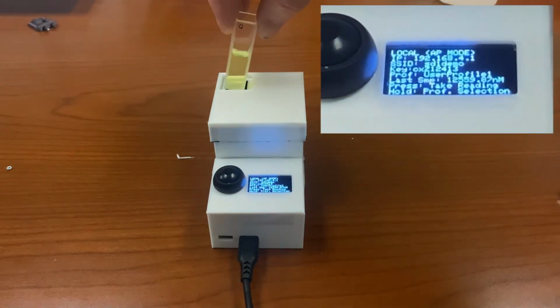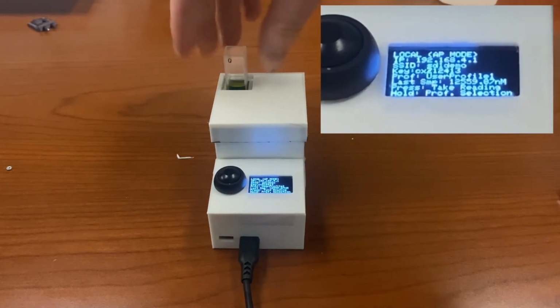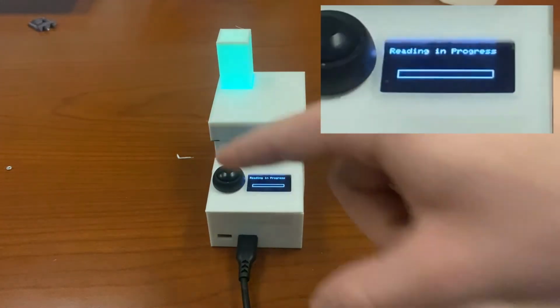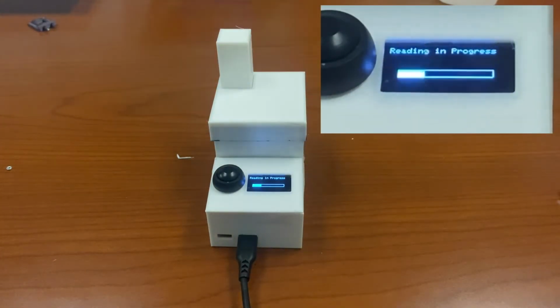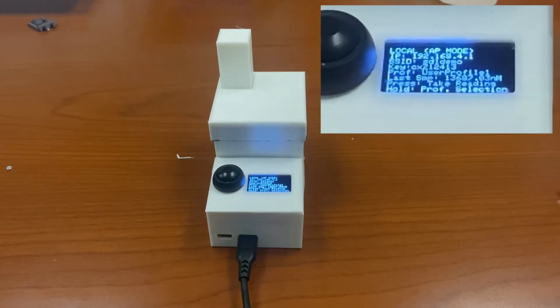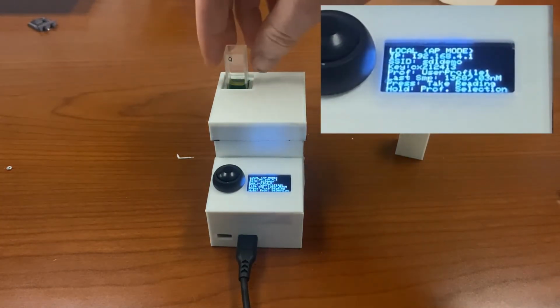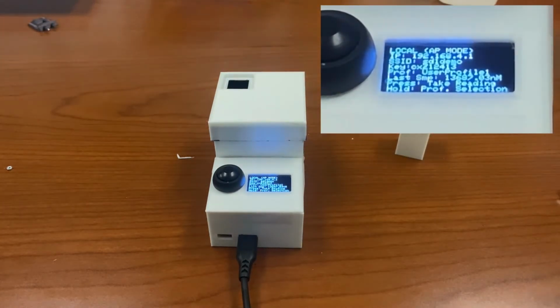We'll start by demoing the normal operation of the device. You can see a sample being inserted, the cover is installed, and the button is pressed to initiate a reading. Here you can see the LED flashing and the reading in progress. Once the reading is complete, you can see the last sample was 13,687 nanomolar. This is very close to what we expect this sample to be. That's a very high concentration.